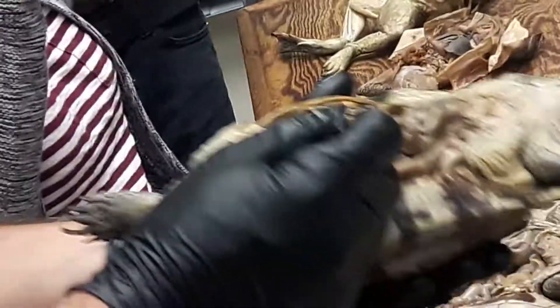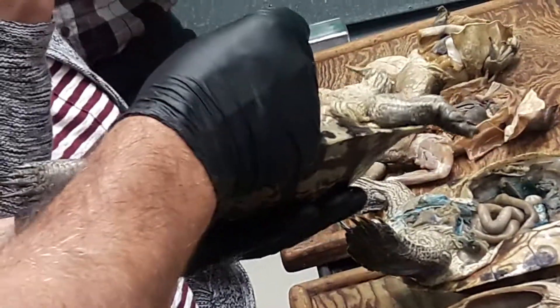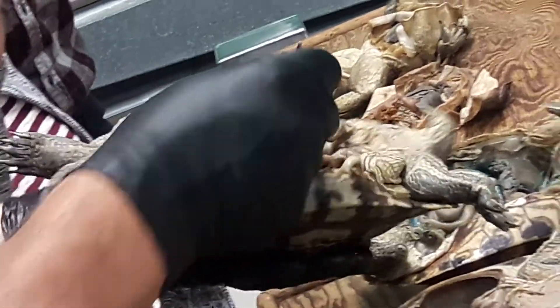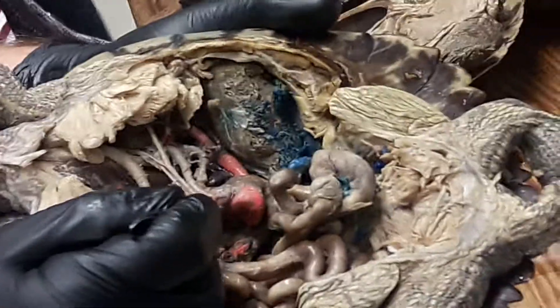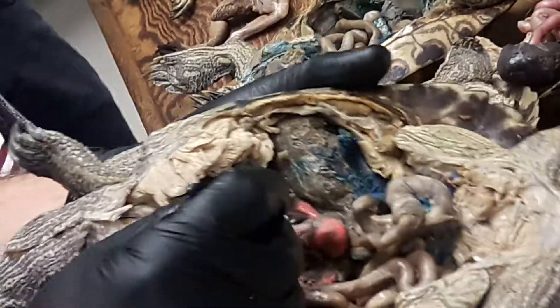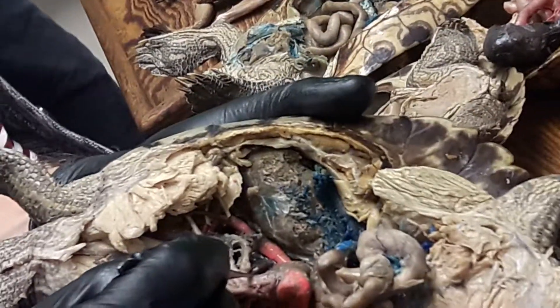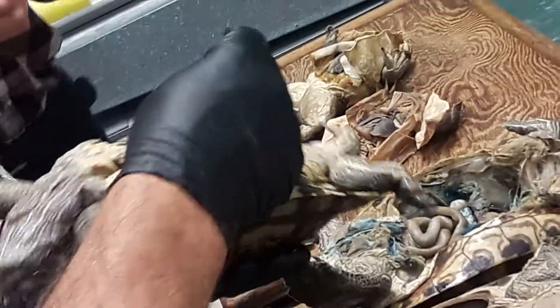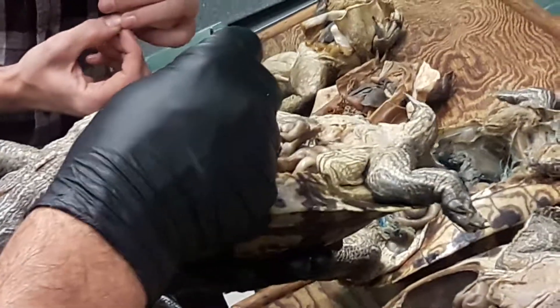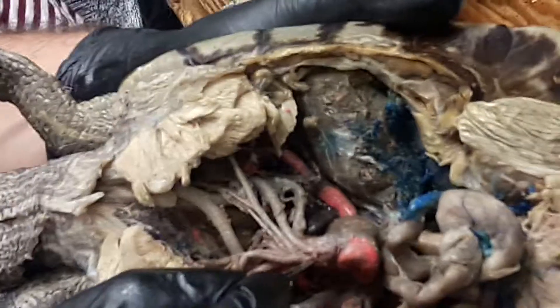Coming out of the heart then, what you see are three major trunks. This first one on the left side of the body is the pulmonary trunk coming out. The next one is the left systemic, and this one on the right is the right systemic. So: pulmonary, left systemic, right systemic.